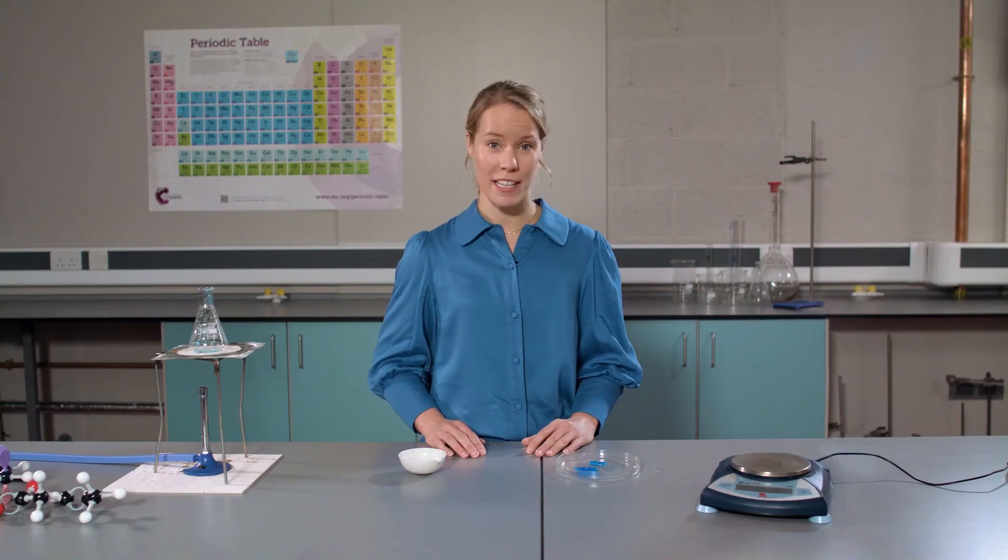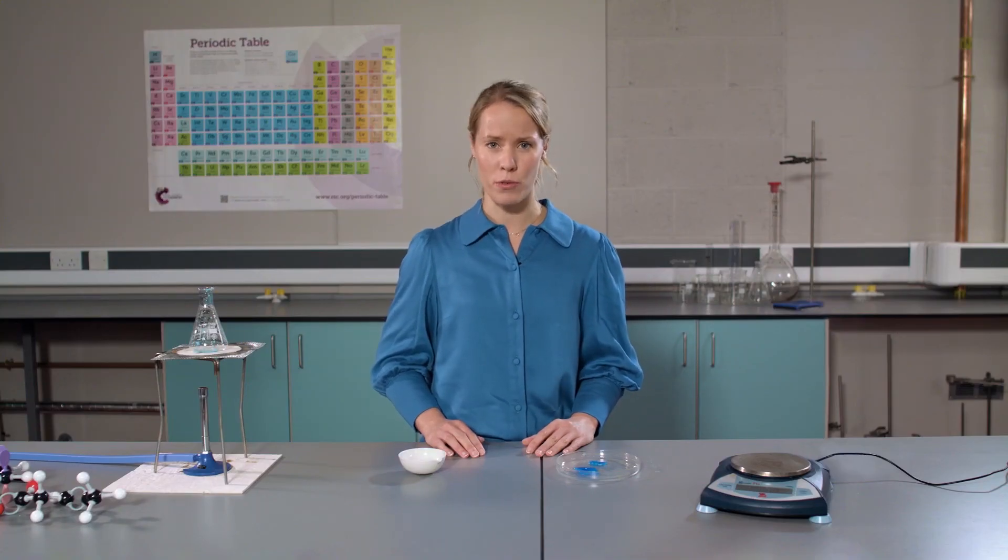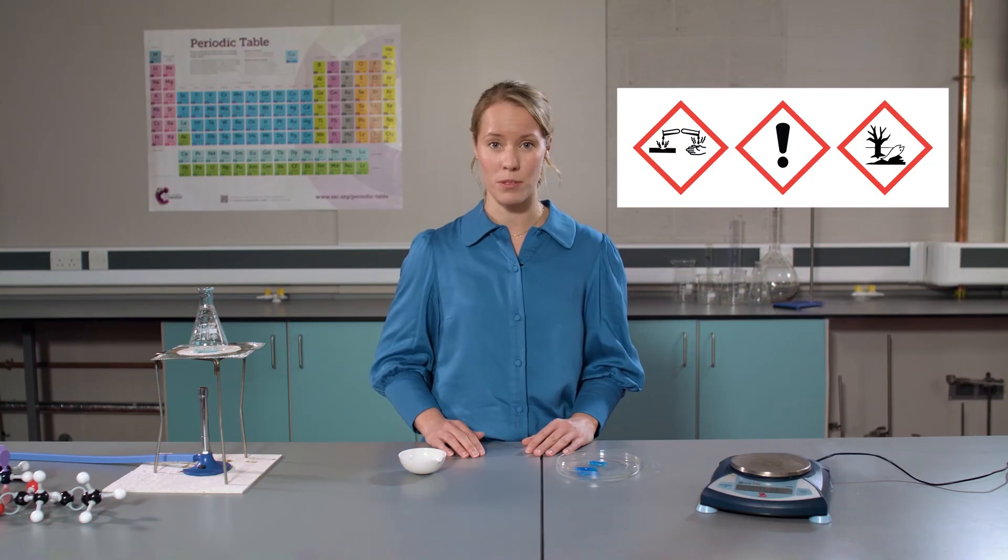It might be tempting to take them home, but it's important that you don't because they do carry three hazard warning symbols.